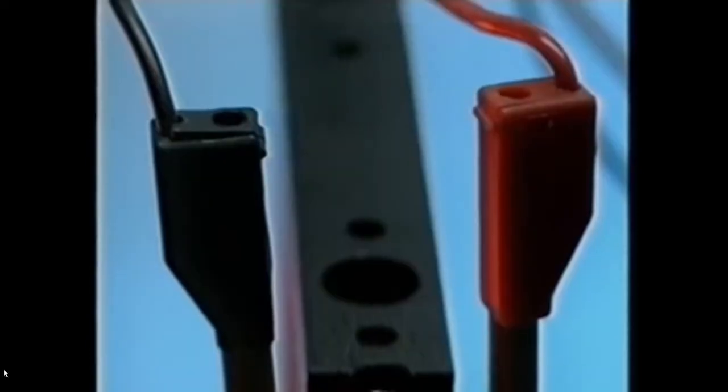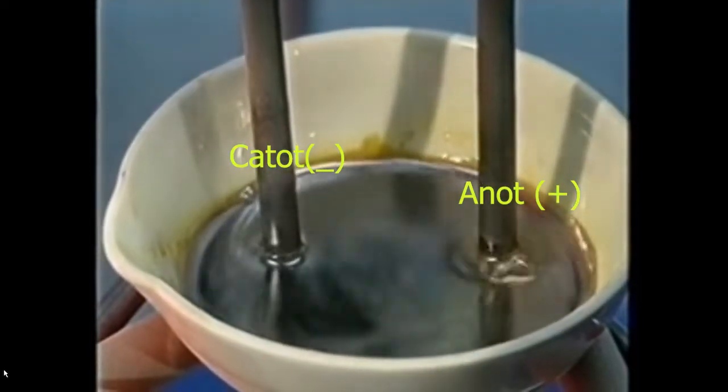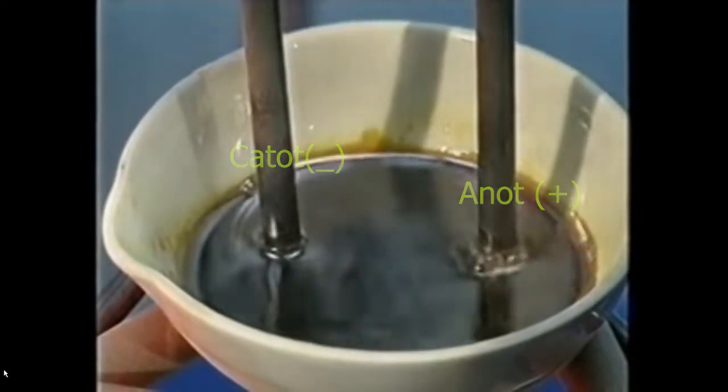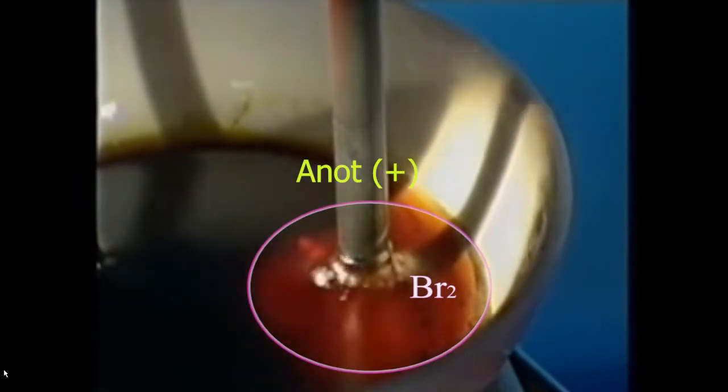In this circuit, the electrode on the right is positive, the one on the left is negative. As electricity passes through the molten lead bromide, chemical reactions start. On the left, at the negative electrode, nothing appears to be happening. But at the positive, bubbles mean a gas is being produced.